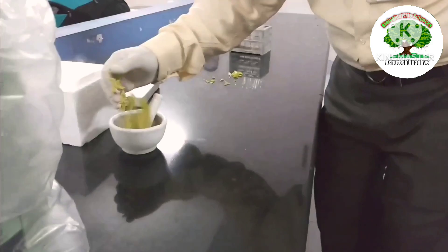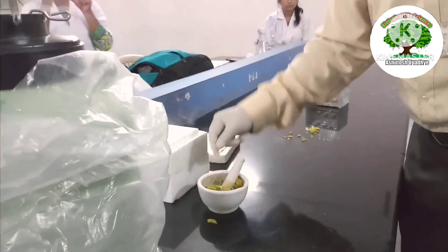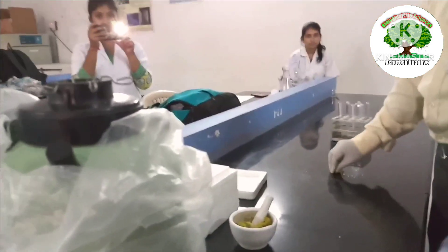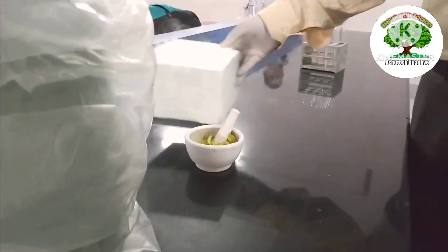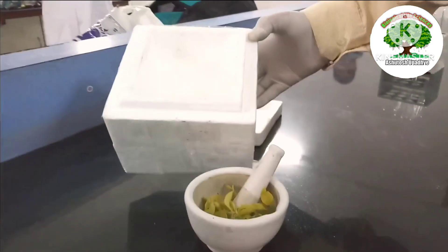You can use liquid nitrogen for various purposes. For example, in this video we are going to use it for DNA isolation. You can see we have taken the tender leaves from a selected plant from which we are going to isolate the DNA. Now we are carefully going to transfer the liquid nitrogen into the mortar and pestle into which the leaves are placed.